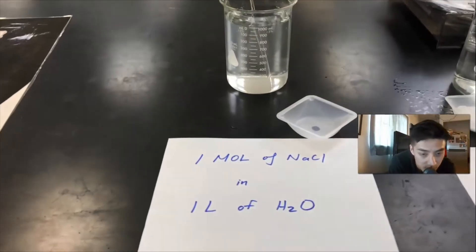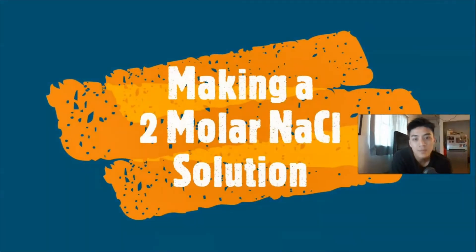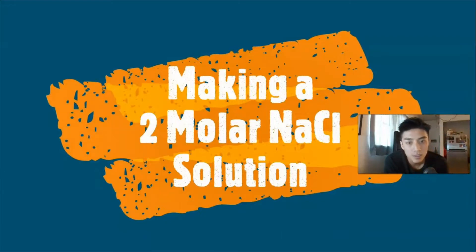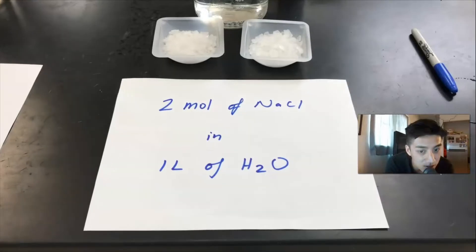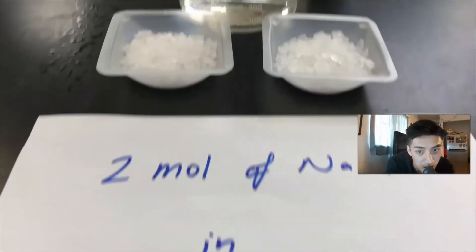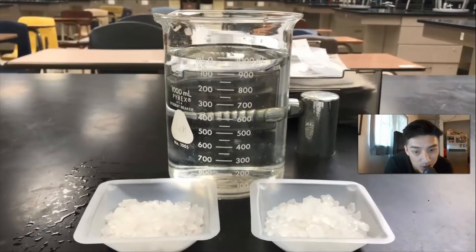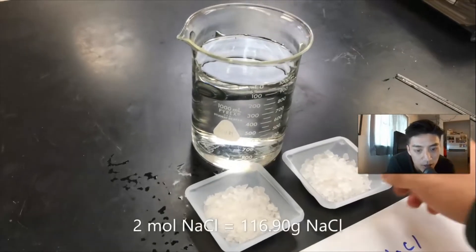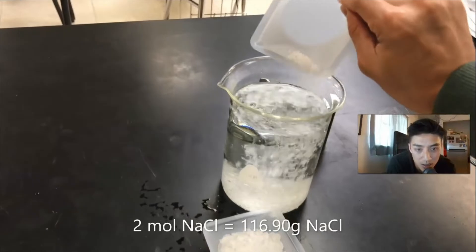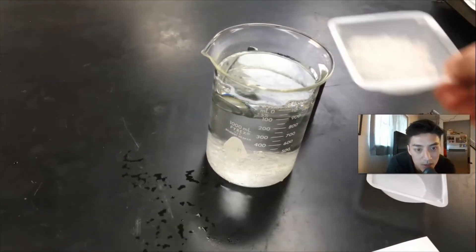This is a one molar solution of salt — it's got one mole of salt dissolved in one liter of water. It's that simple. Now, what if I want to make a two molar solution of salt? You just double the amount of salt: instead of 58.45 grams, this is 116.9 grams of salt, and that's two moles of salt.